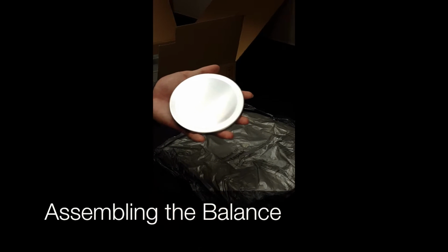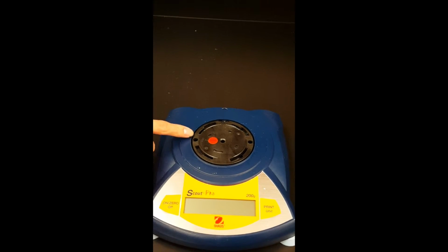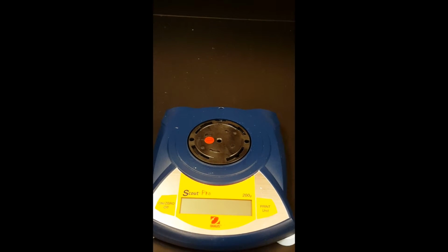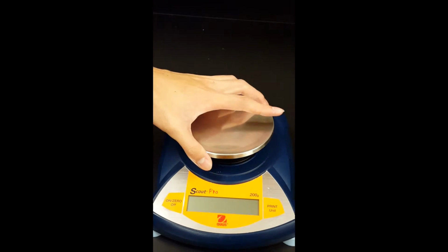Now we're ready to put the metal weight plate onto the balance. There's a small hole in the middle of the balance right here that matches up with the plastic piece on the weight plate. Simply place the peg into the hole to install the metal weight plate.